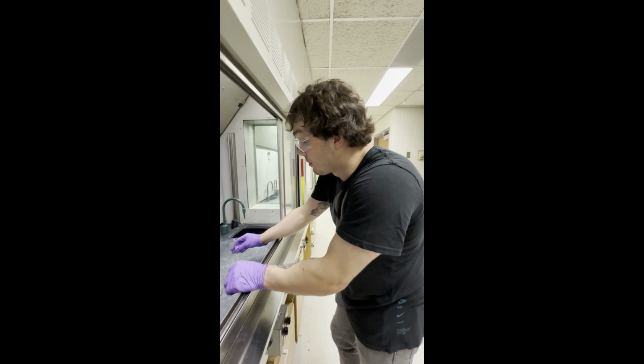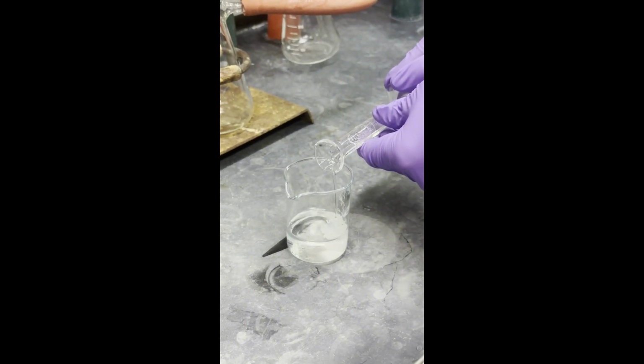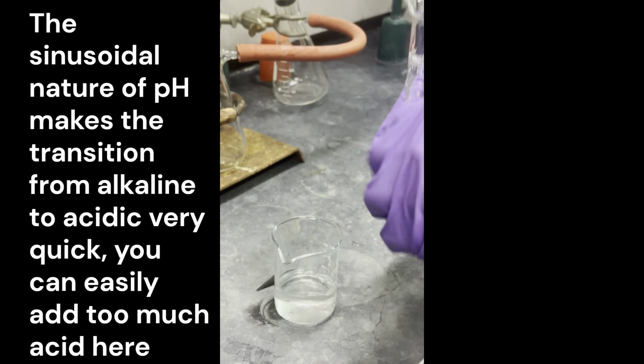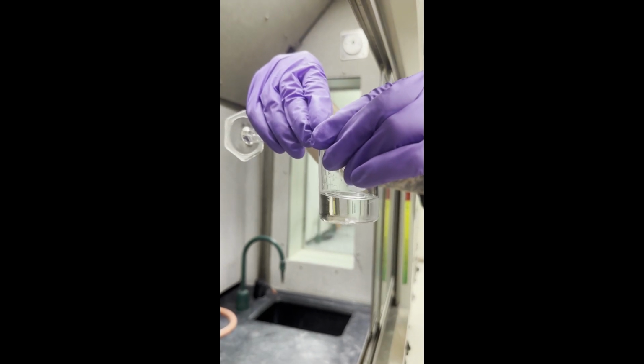Okay, so we're going to slowly acidify our solution, and hopefully our product will precipitate. We want to slowly do this, and if you watch, you can see it start to precipitate as we add it.